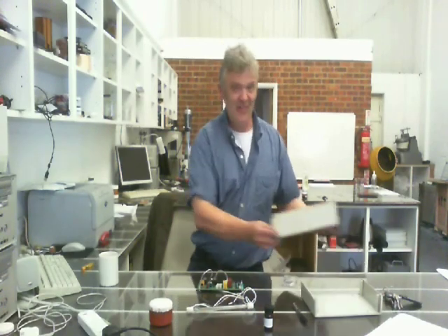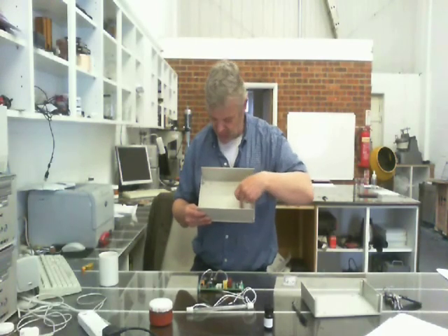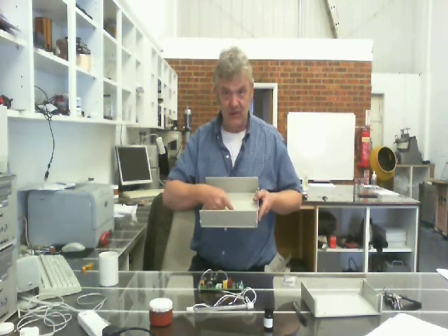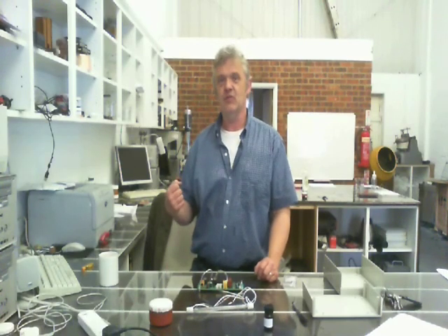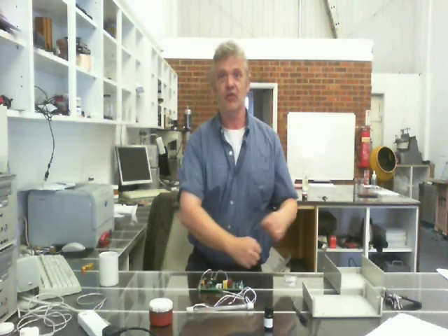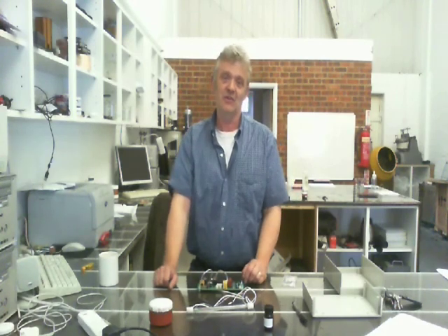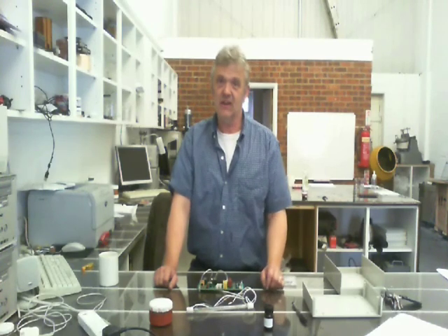So, I bought this, which is an instrument case. Now, the unit will fit quite nicely here, and the lamp will fit quite nicely there. So, I could make it as one whole unit by cutting a slot in the bottom, putting an aluminium reflector on, and then soldering the whole thing together. Or I could make it as two separate units, because this lamp, when it flashes, actually gets really quite hot. So if you flash it a lot and often, then it's going to get hot in there, so we need to provide some kind of cooling and some kind of venting, or separate the two systems so that we've got the electronics in one case, the lamp in another, and we can move the lamp over the area that we're going to try exposing. So those are the ideas that we're working with, and that's what I'm going to be doing now.